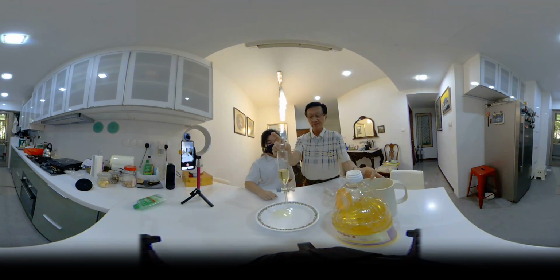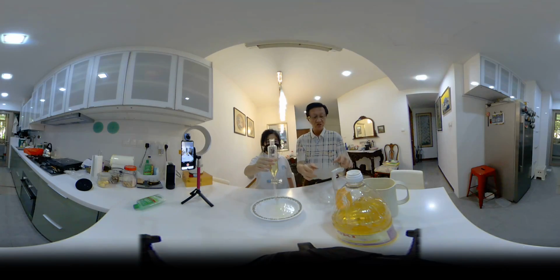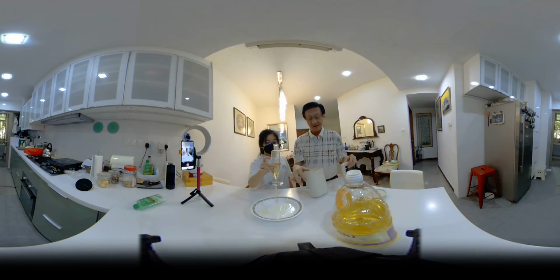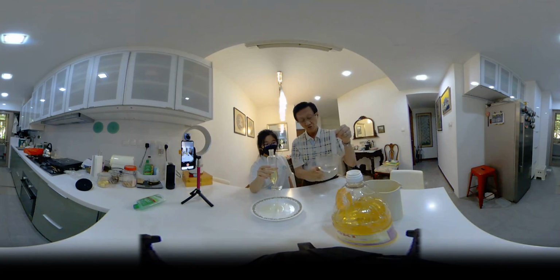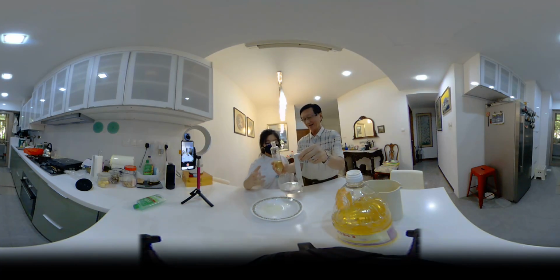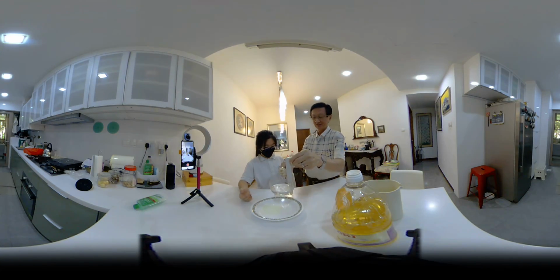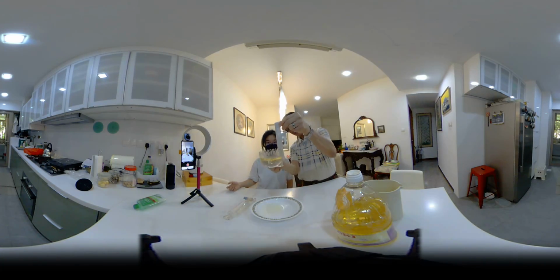Now this separating funnel is also used by housewives to separate the oil from the soup. Let's say this is the soup. Then people are very scared about the oil, so they don't want the oil, right? They don't want the oil. So can you see the oil is on top?